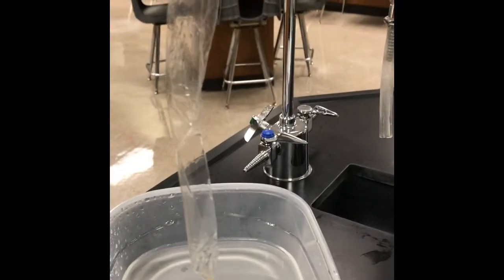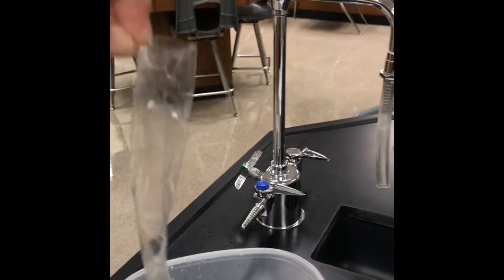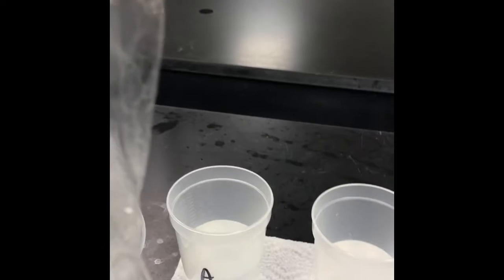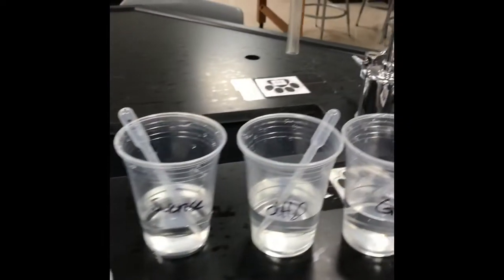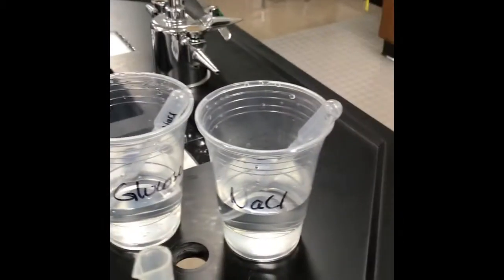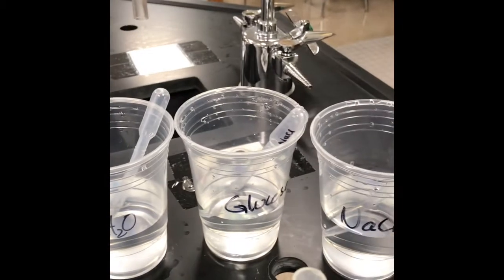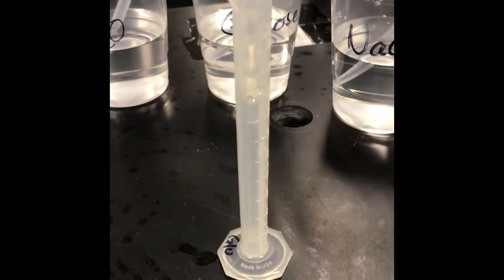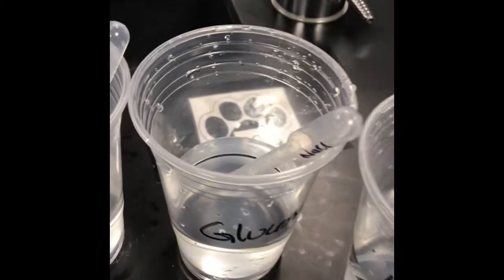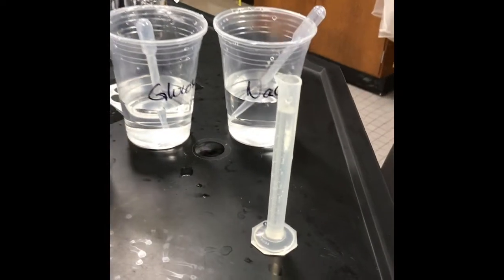Okay, so I have my knot in one end. You can see it down there at the bottom. I'm holding the top end with my fingers, and this is going to be our setup A. So we're ready to take 10 milliliters of glucose. So these are my solutions in the cup. You can see how I have them prepared. So we're going to use a pipette and take 10 milliliters of glucose. I have my little mini graduated cylinder so that I can have some accurate measurements. So I'm going to use that plastic pipette and transfer 10 mils of glucose to the graduated cylinder. So there's my 10 mils.